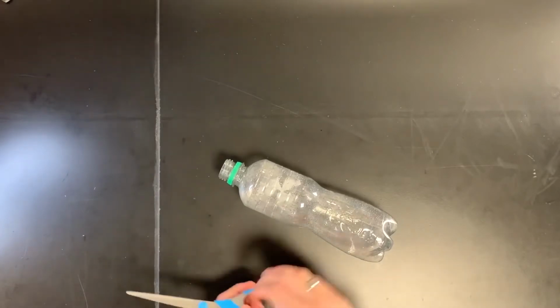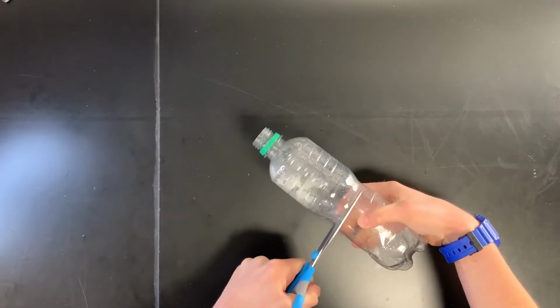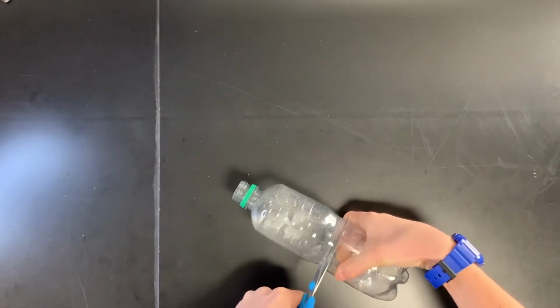Then what we're going to do is we're going to take one of these plastic bottles and we're going to take our scissors and we're going to cut it in half. So the easiest way is to make a hole, and then we're going to cut around this hole.